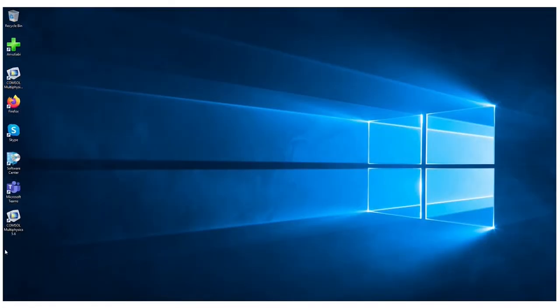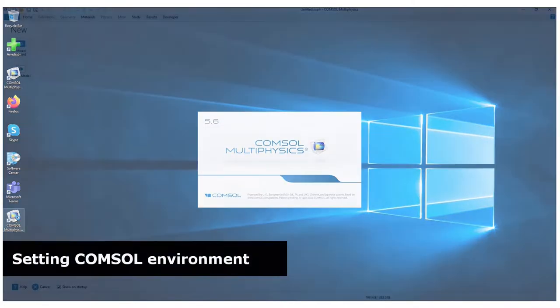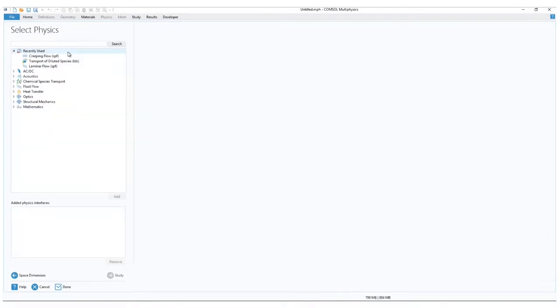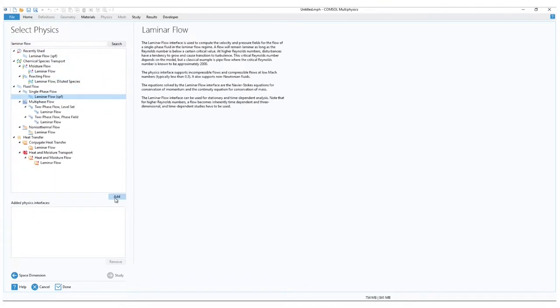Moving over to COMSOL. On the opening view, choose Model Wizard, then 2D. Next, we will choose our physics. Use the search bar to locate laminar flow. Choose the single phase flow and add.